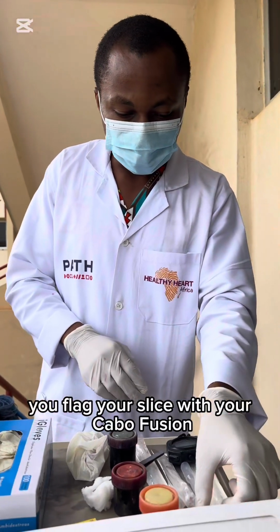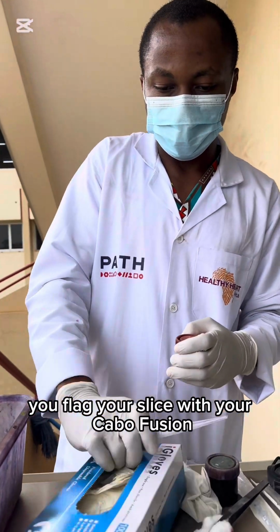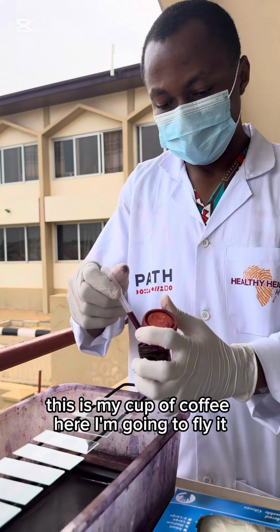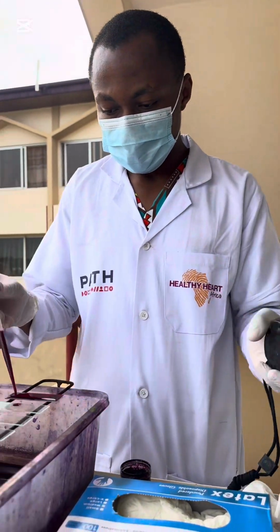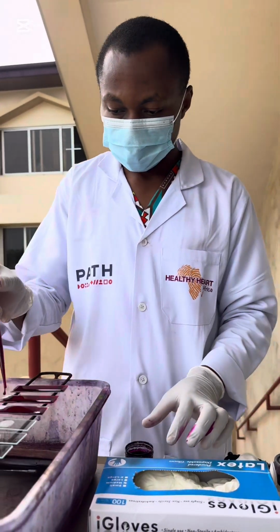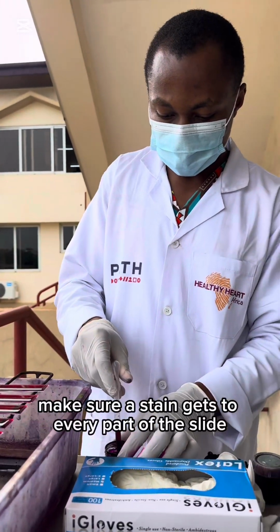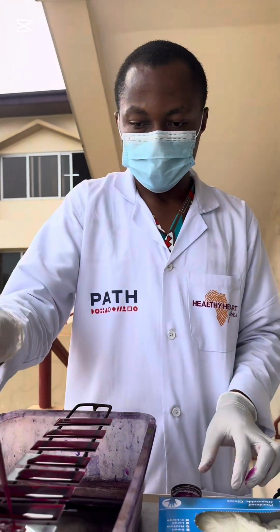Like I mentioned, you flood your slide with your carbol fuchsin, the primary stain. So I'm going to do that. The carbol fuchsin, flood it. Flood it. We're going to stain that for 5 minutes. Make sure the stain gets to every part of the slide. Very nice.